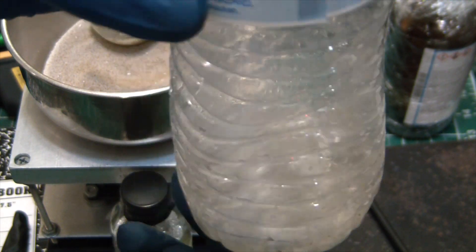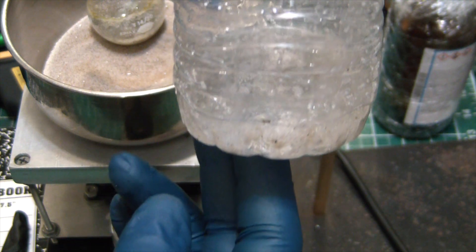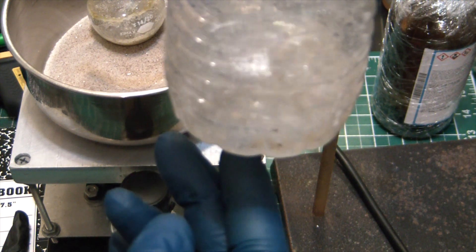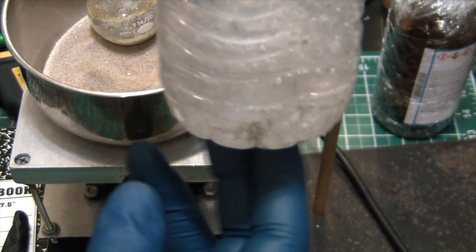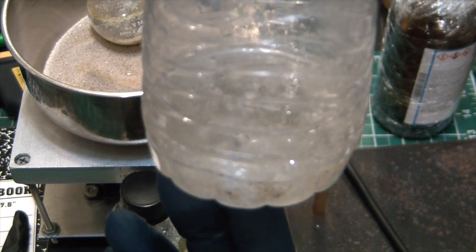And as you might be able to see, we are definitely seeing a reaction with some of the leftover water in here. So we did make some potassium, just didn't coalesce or I guess maybe it didn't have enough time. But we definitely made potassium, just not enough to really see.